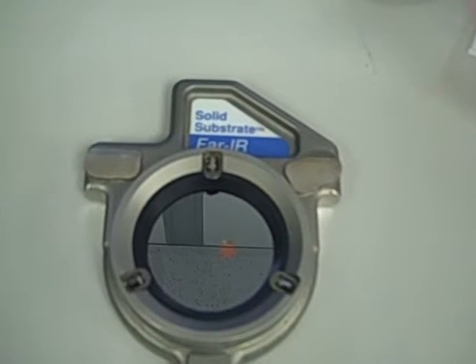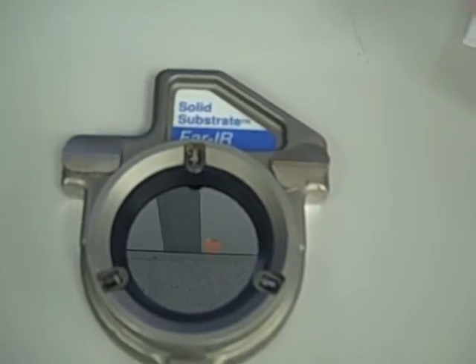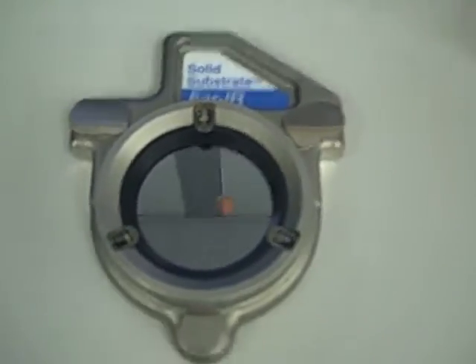Today I will be showing you guys how to change a beam splitter. First thing you have to do is go to your computer and make sure you are running no scans. It will pop up a number slash a number showing how many scans you are running right here. But we are not running any scans right now.